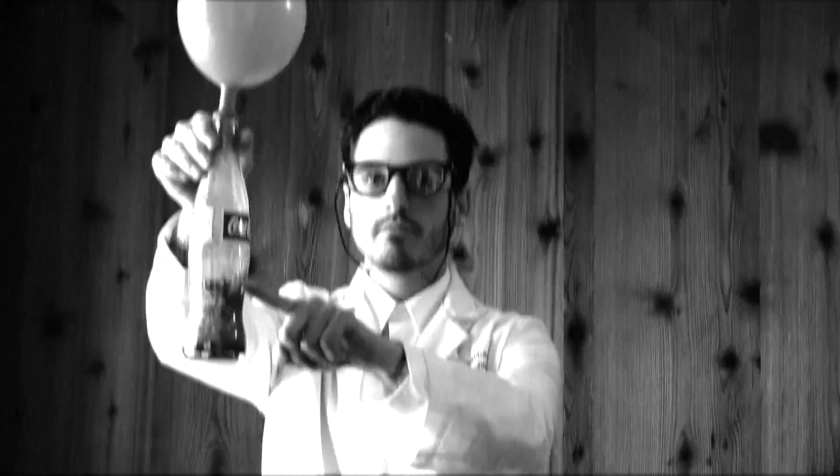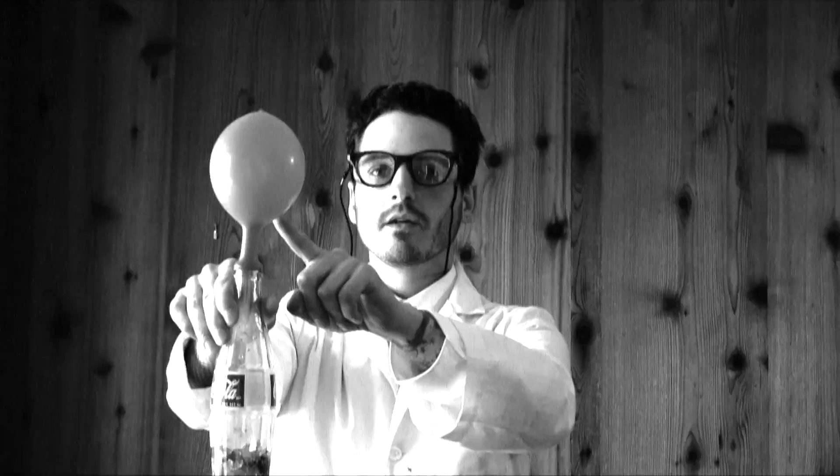Sign number three: formation of a gas. Inside this bottle, there is sodium hydroxide and aluminum. When water is added as a catalyst, it frees the hydrogen from the sodium hydroxide. Bubbles form, and it is captured in this balloon. We will come back to this.